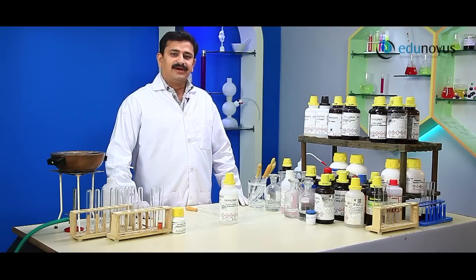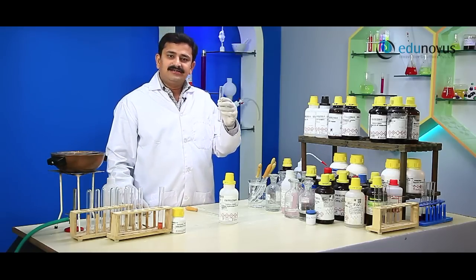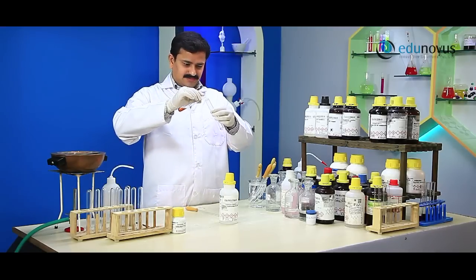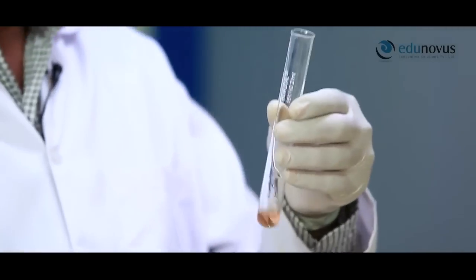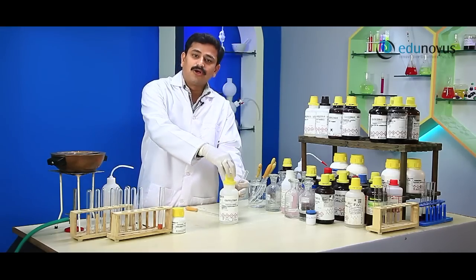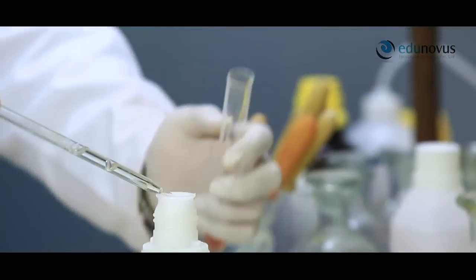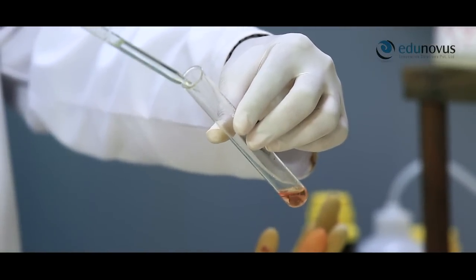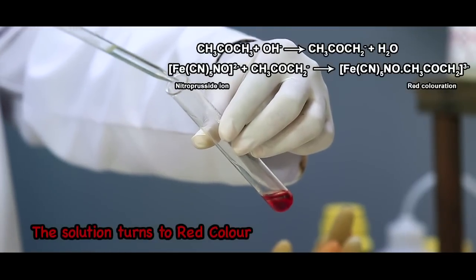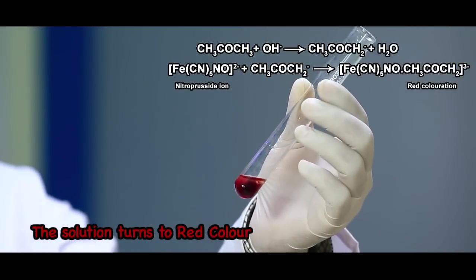Ketones can also be confirmed by using the sodium nitroprusside test. To the given organic compound, add a few ml of freshly prepared sodium nitroprusside solution, and then add a few ml of sodium hydroxide solution drop by drop. The appearance of red colour in the solution indicates the presence of a ketone. Here you can clearly see the formation of red colour, confirming the presence of the ketone.